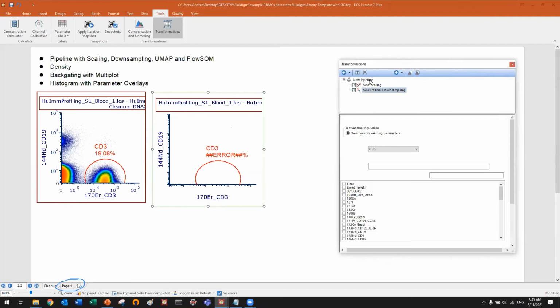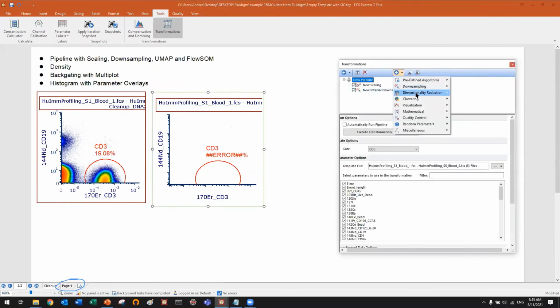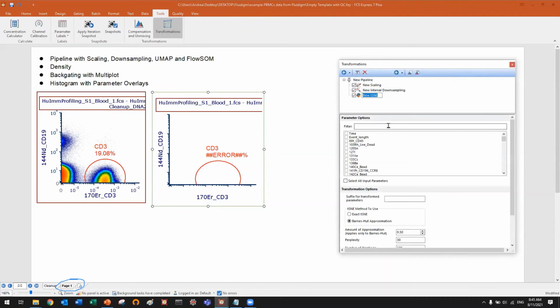And then I can add, for example, t-SNE. Which are the parameters we want to run t-SNE on? Well, the scaled parameters. So I should go here and say, I want these. Instead of selecting all of them, if you want to select all the scaled ones, you can do a filter, and then do a select all, and only the scaled parameters will be selected.